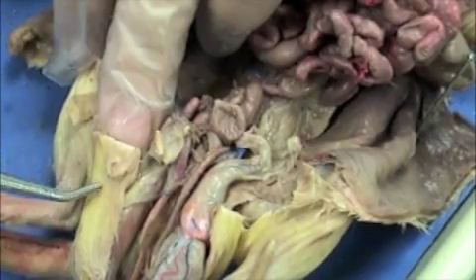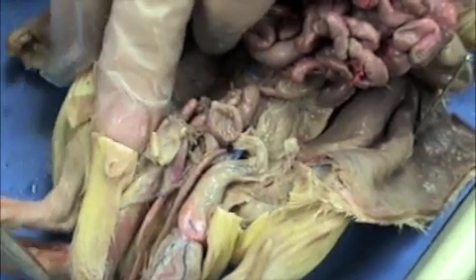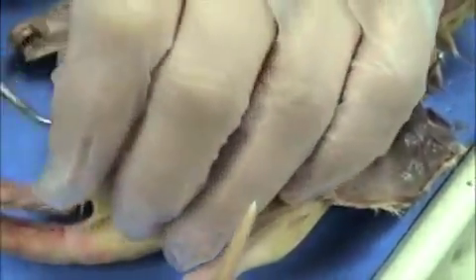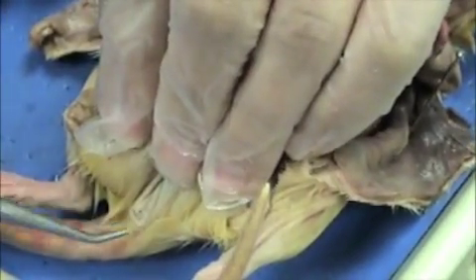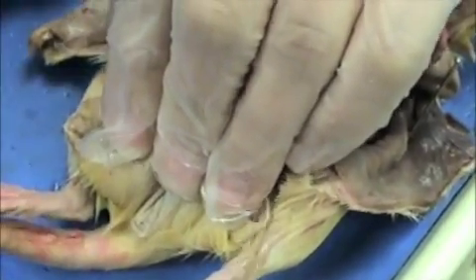It's located here. Lift up the testes and you have the anus right here at the base of the tail.